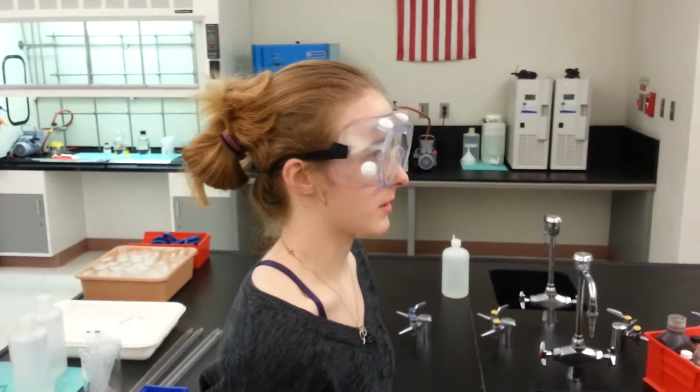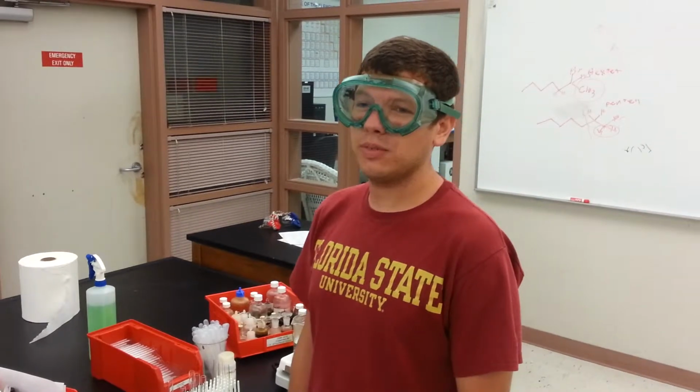We are in the Organic Chemistry 2 lab, and we are going to be demonstrating 3 different ways to test for qualitative analysis. My lab mate Matt is going to be giving us the reaction mixture for our Tollens test. The purpose of the Tollens test is to determine whether or not you have a ketone or aldehyde functional group attached to your molecule.